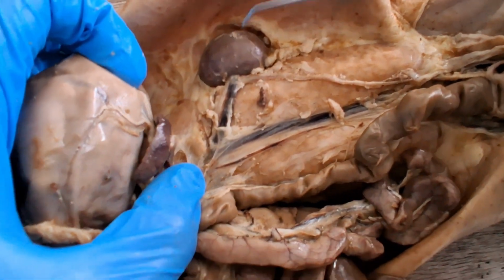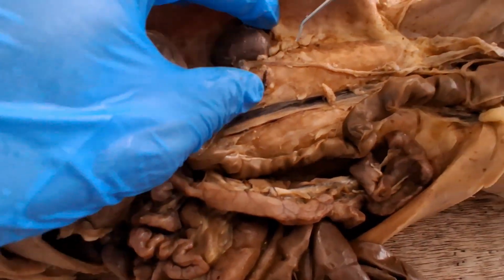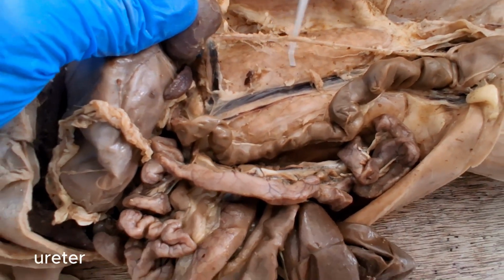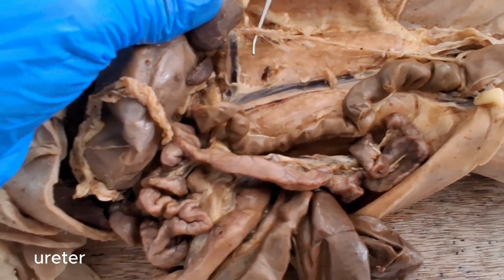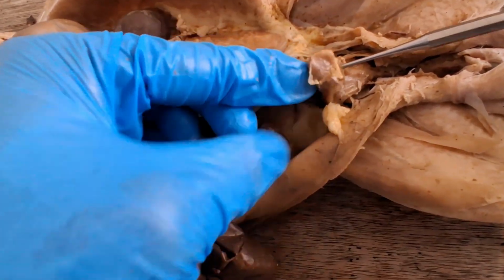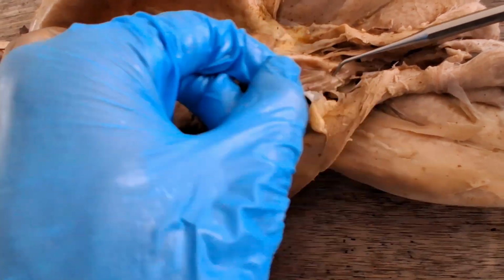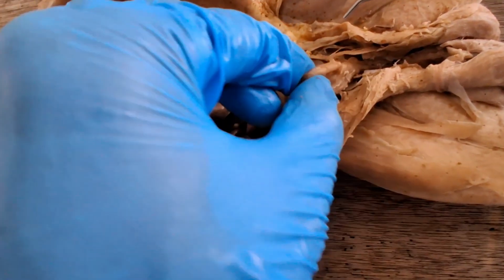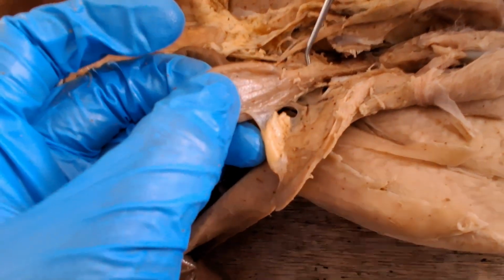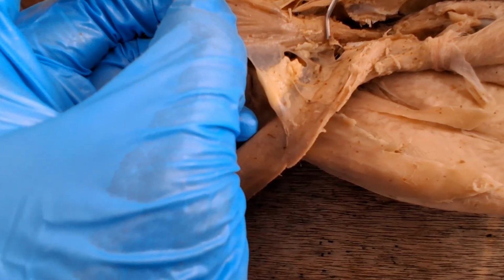And then a kidney will filter it, produce urine in the process, and then send the blood back to the renal vein. So the urine containing the waste will be flushed down to the ureter, this long white string-like organ. The ureter will send the urine to this sac, the urinary bladder. The urinary bladder has an immovable fundus, and then the movable part would be the apex. And then, call of nature, from the urinary bladder, urine goes down to the urethra.